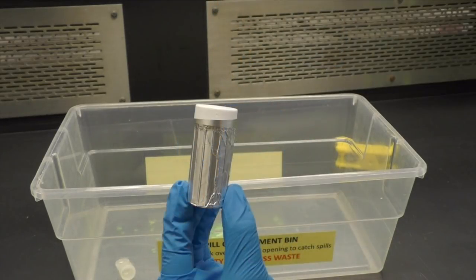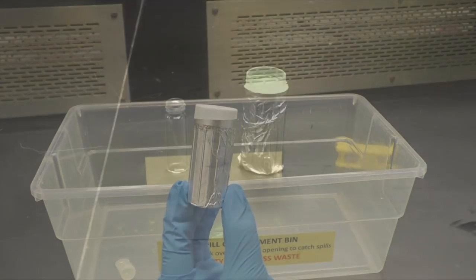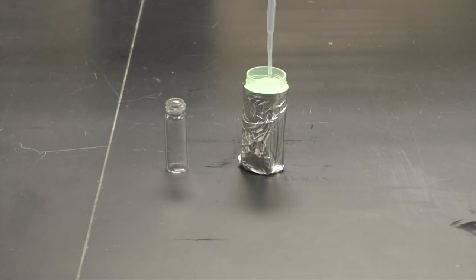The glow stick solution is sensitive to air and light, so while waiting, the vial should be capped and covered in aluminum foil. The vial block can only hold one-dram vials, so you will only need to add about 1.5 milliliters of glow stick solution initially.